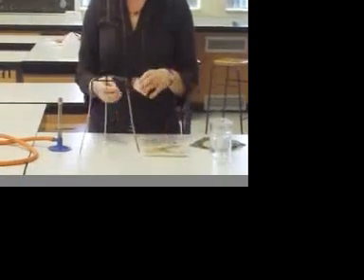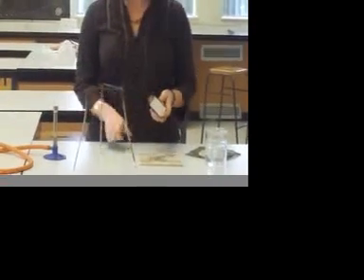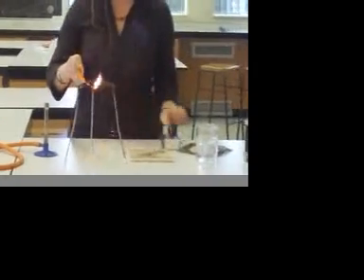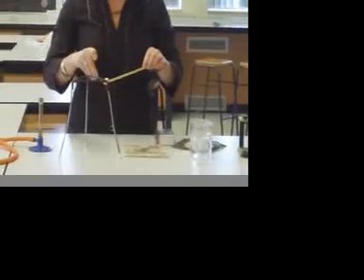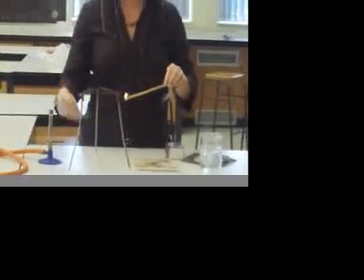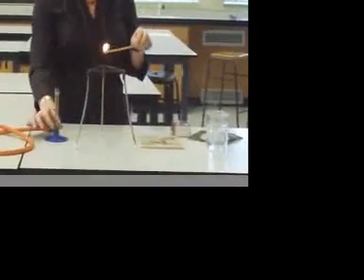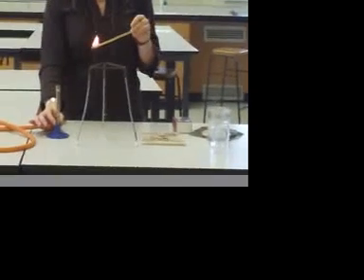The first thing you need to do is light your Bunsen burner using a splint. Make sure the valve on the Bunsen burner is closed, then turn on the gas tap and you have a nice yellow safety flame.